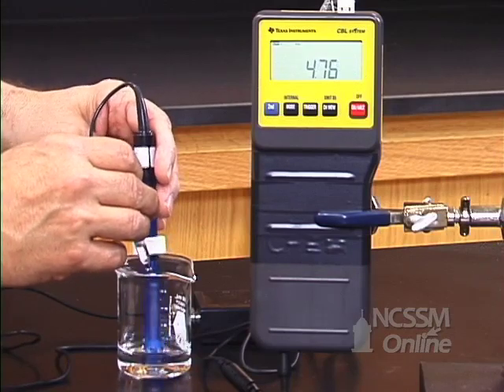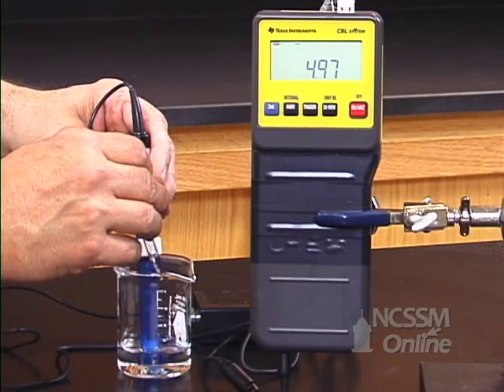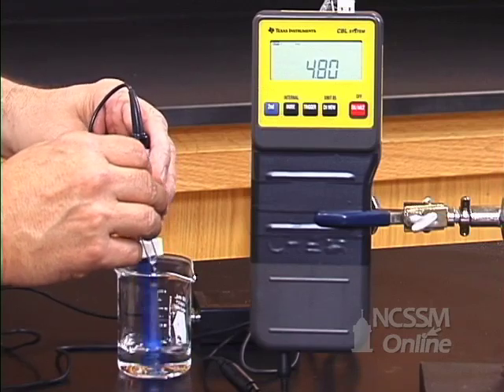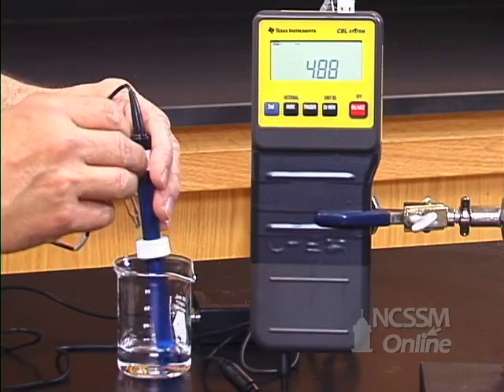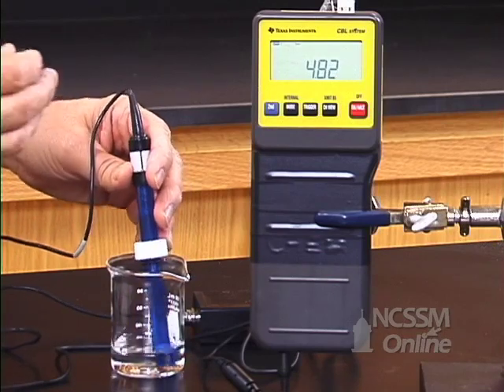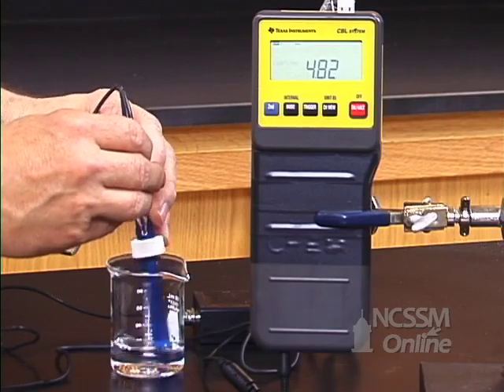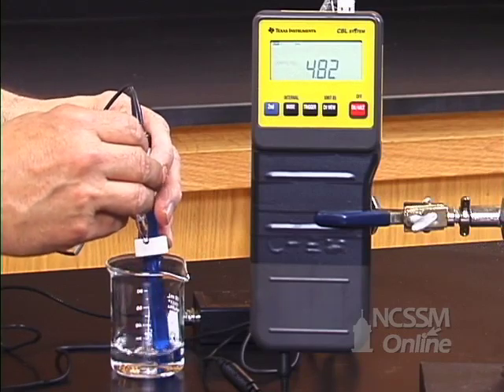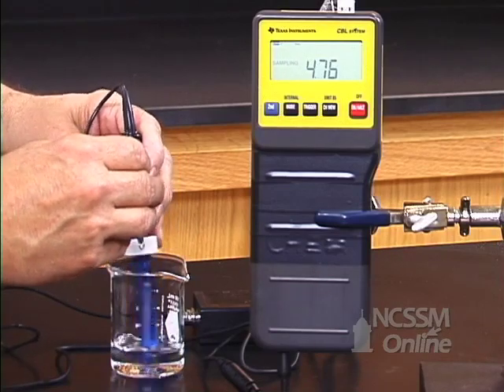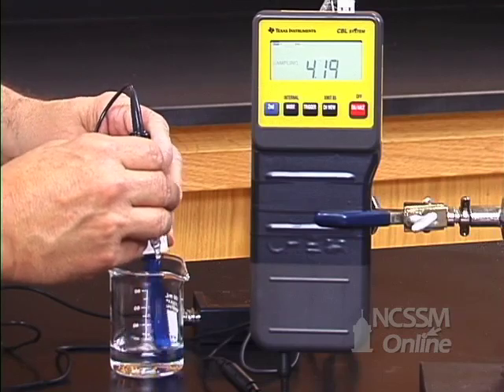Two drops. After ten drops, the pH has only dropped slightly. A buffer does not maintain absolutely constant pH. What it does is moderate the change in pH.